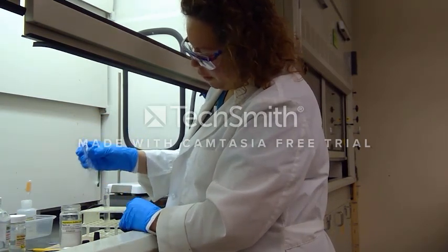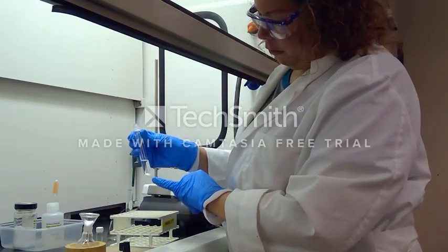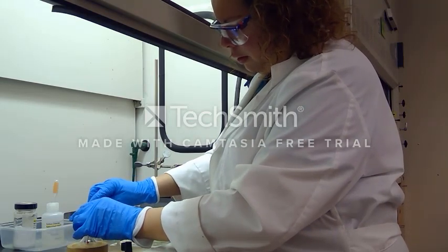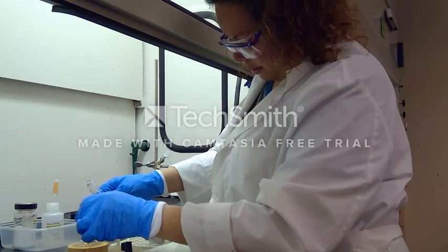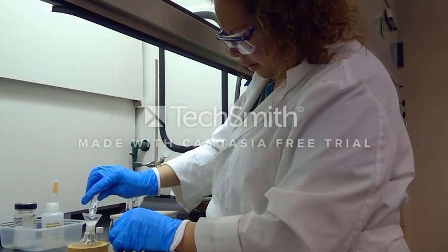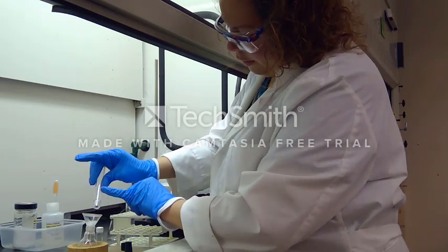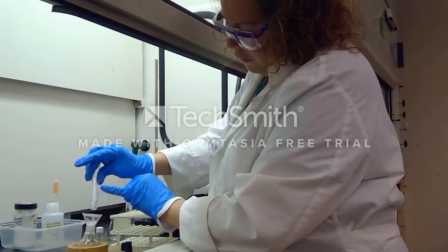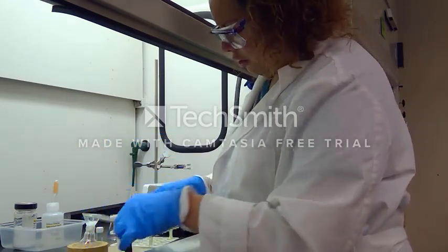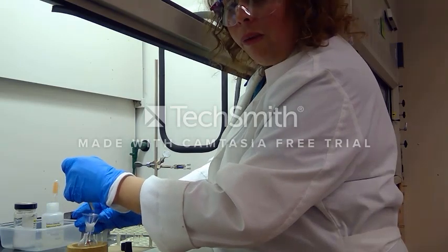We filter directly into a pre-tared 25 milliliter round bottom flask using a simple funnel with a piece of cotton. I let the sample flow through and the magnesium sulfate is behaving like a solid chunk of salt and not coming through easily. I gently press down with my spatula to release as much liquid as possible into the round bottom flask. I'll see you at the rotavap in just a moment.